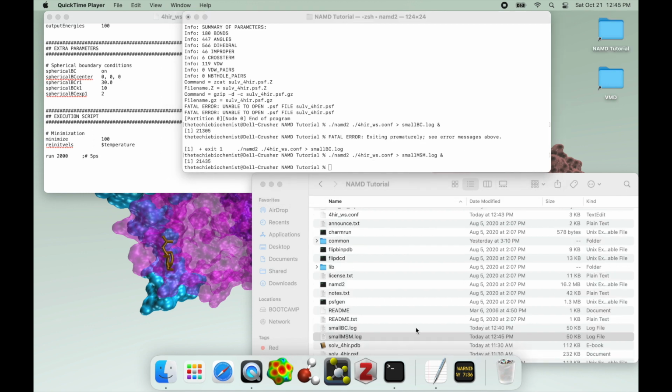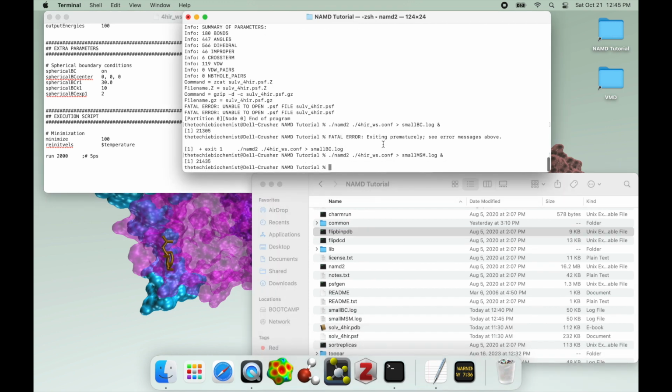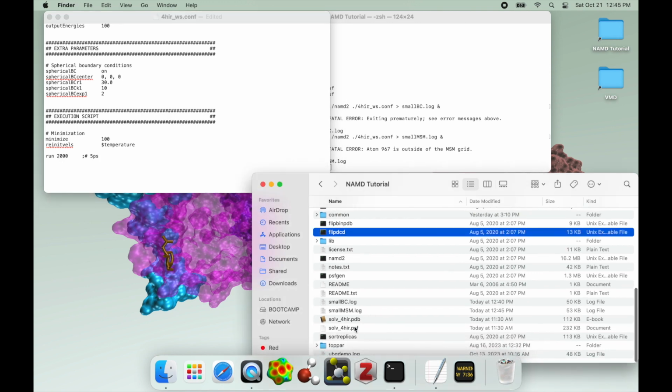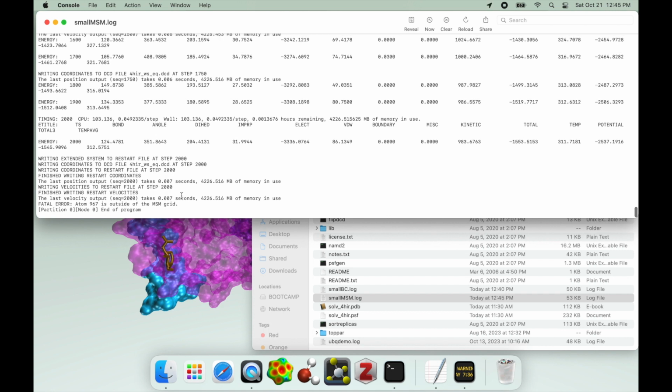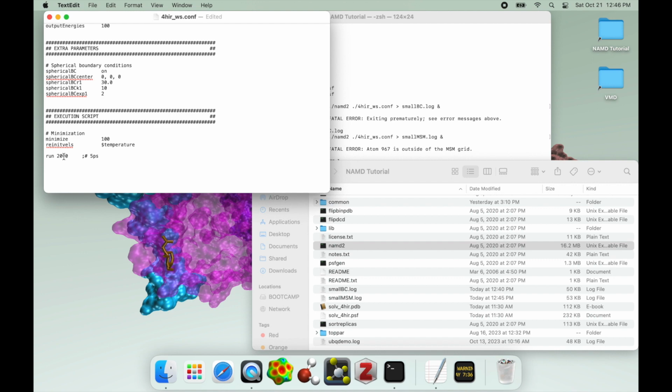This time it actually didn't throw that error. That happens occasionally. Basically, you just occasionally don't run into those errors. So if we open up the log, it did happen, but it only happened at the very last step, so it's fine. But you can see that is the error that you had, and if it was trying to continue on past this point, it would have just died. As it is, we probably did get a full simulation run.